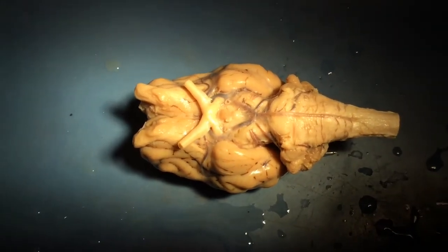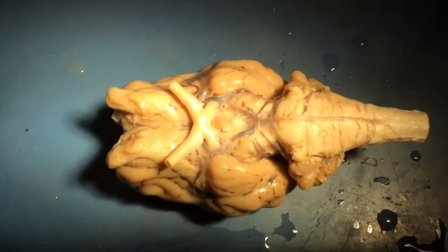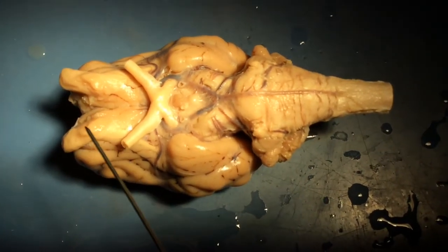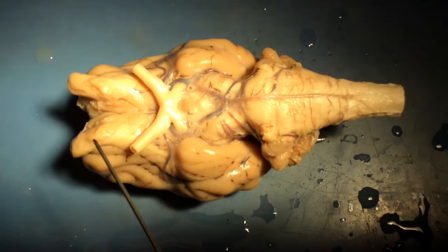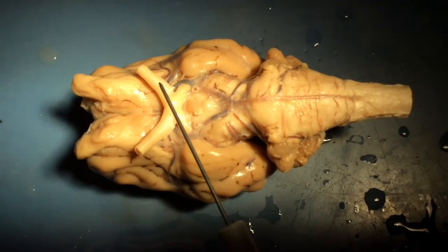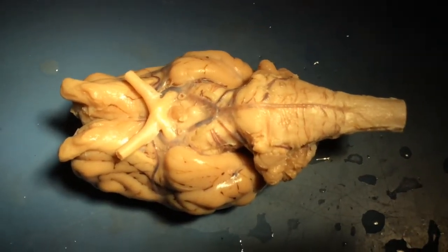Okay. You may be able to identify some smaller nerves. There are 12 nerves that emerge off of the brain. They're numbered from 1 to 12 from front to back. The first one is the olfactory nerve, which you usually can't see because it's a bunch of little fibers that run through holes in the skull. But the optic nerve is the largest, and that one's very prominent. It's the largest in the sheep.